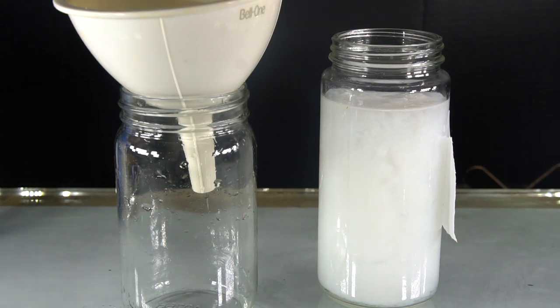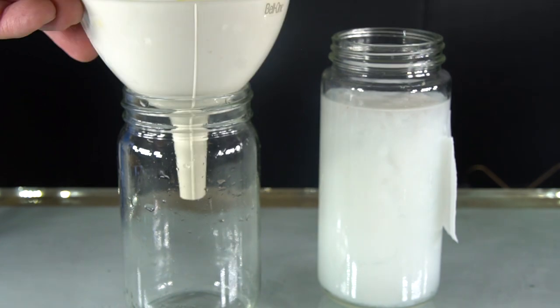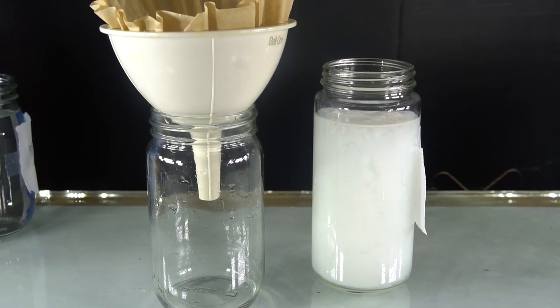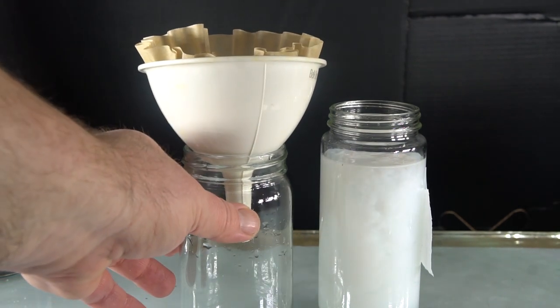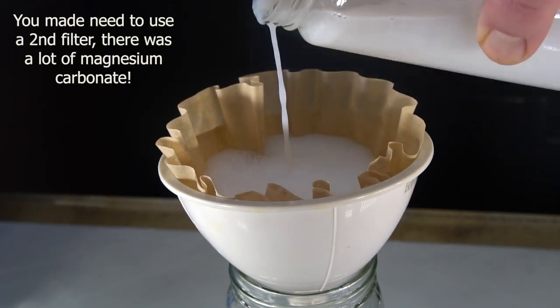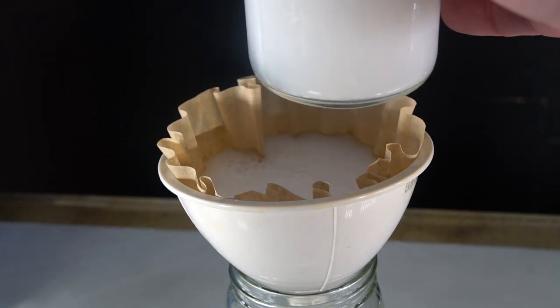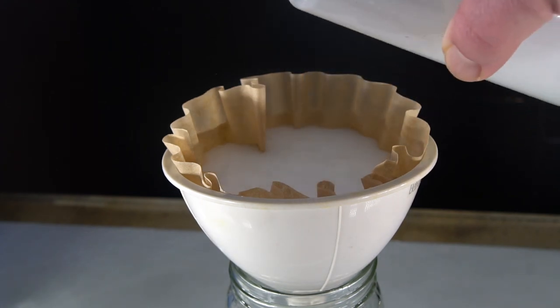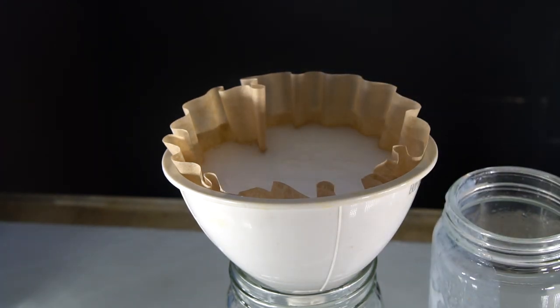Now let's take a look at our magnesium carbonate precipitate. How do we separate it from the liquid? Let's filter it out. I'm going to use a simple coffee filter. This is called gravity filtration. It will take at least 30 minutes to filter. After all of the water goes through the filter, you can wash the magnesium carbonate with a little water to make sure you wash out any remaining soluble salts, like sodium sulfate, into the remaining liquid in the jar, which is called the filtrate.